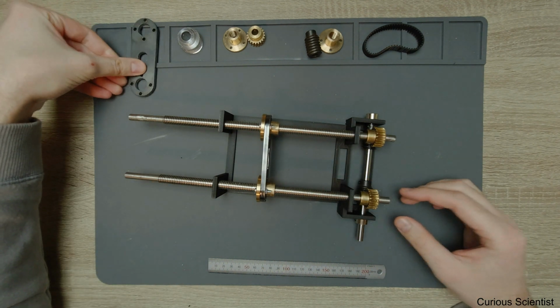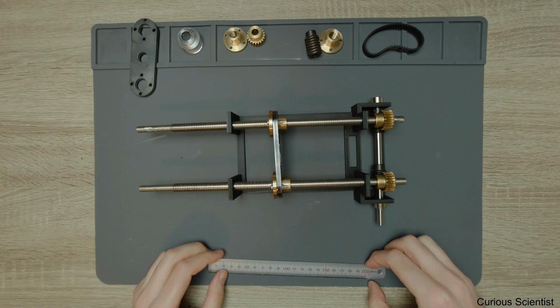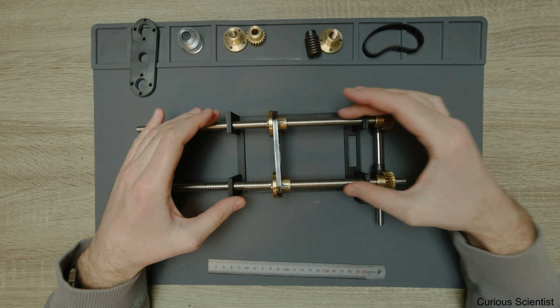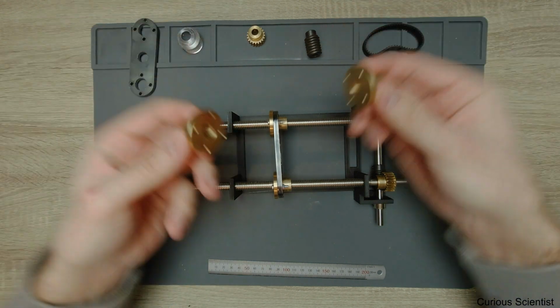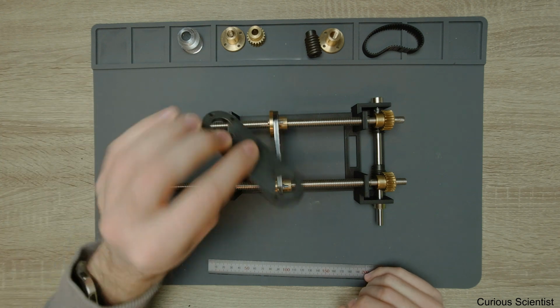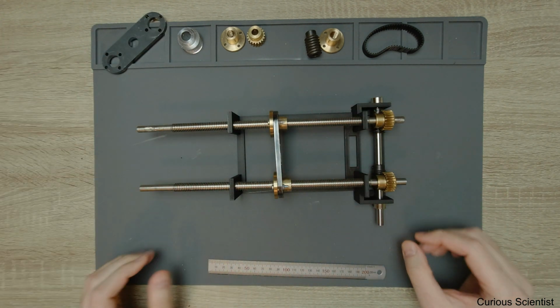But the final version of this will be cut to a shorter length, so I can put on these two screws from one side, put on the nuts, slide it back, and put on the nuts, these two guys here, from the other side, and this crosshead as well, actually three of these, and then put everything together.